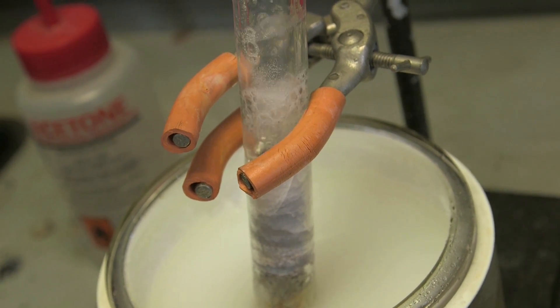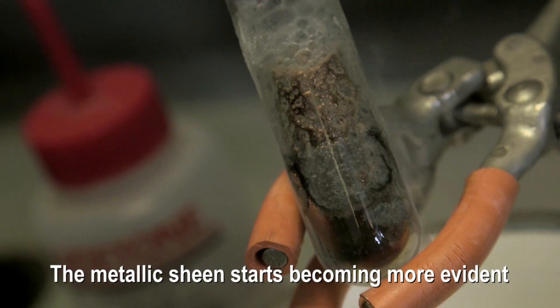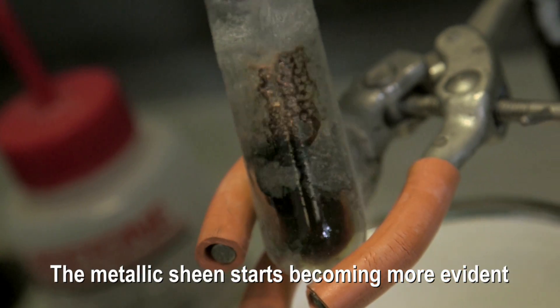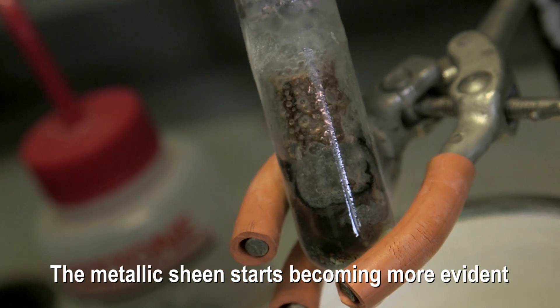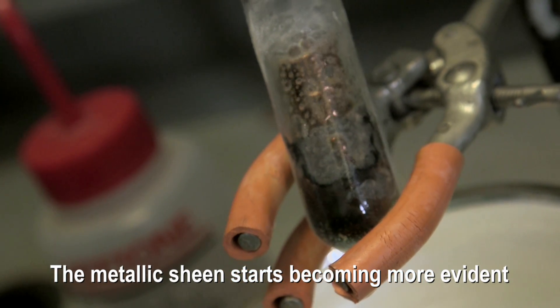The last remnants of this metallic solution here. It looks metallic still. There's a lot of electrons in there. We put quite a lot of sodium in there.